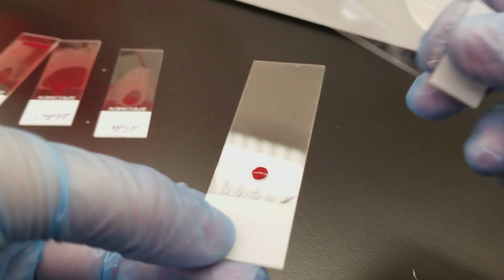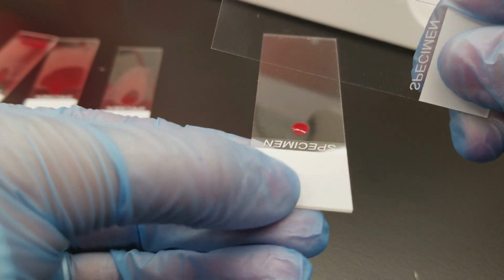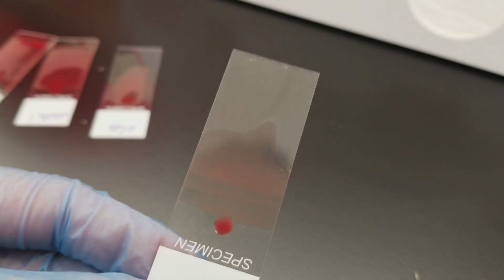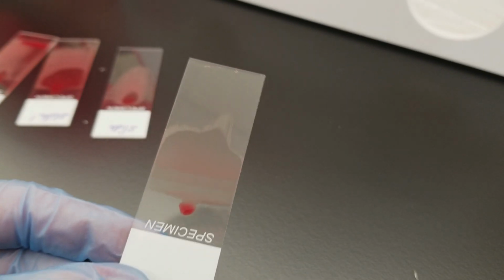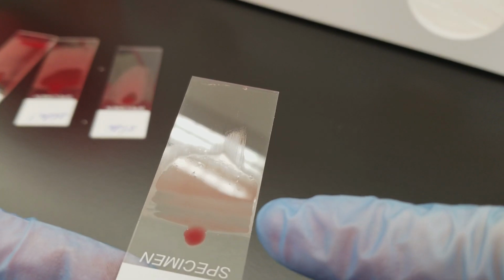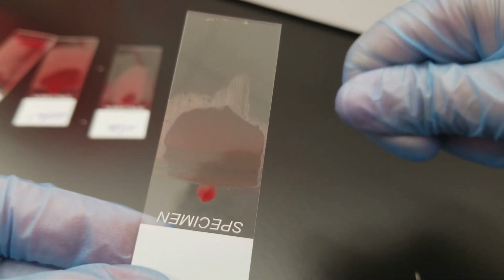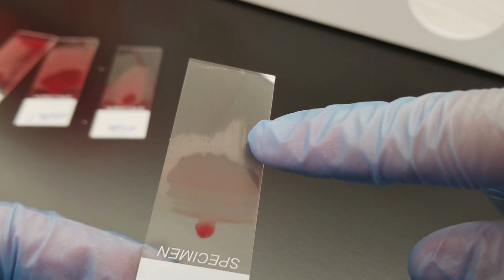Okay, so we're going to do this one. All right, so that's the dirty side. You can push it back and let it spread and then spread it across. This one was bad too. I swear it's so hard to do on camera. I did some really great ones last week, but I want to show you this one too because it's very poorly done. Notice that in the thick area where you should have a good thick covering of the specimen, you have all these horizontal lines, which shows unequal pressure when spreading. And that's the same idea as having these tails out here.